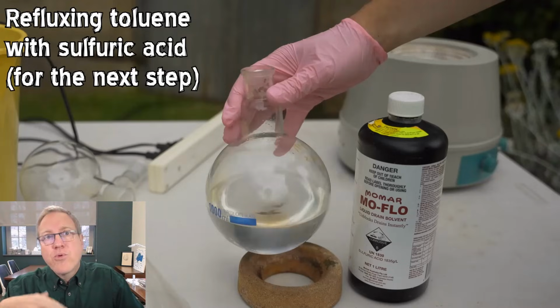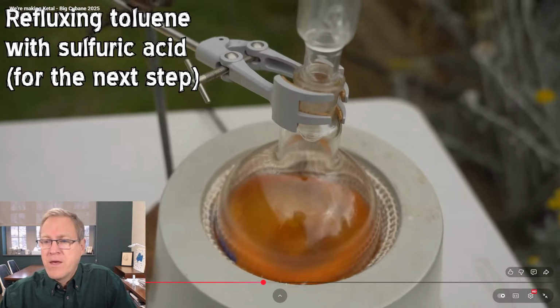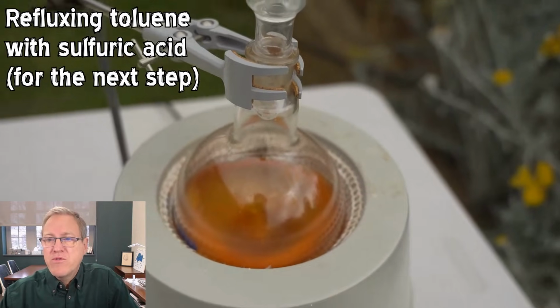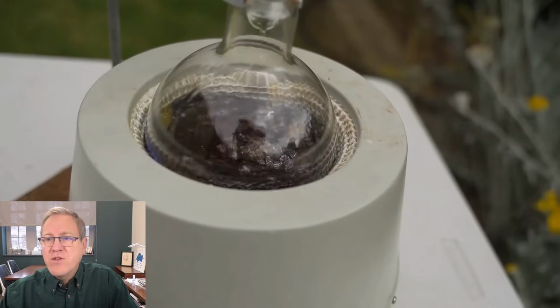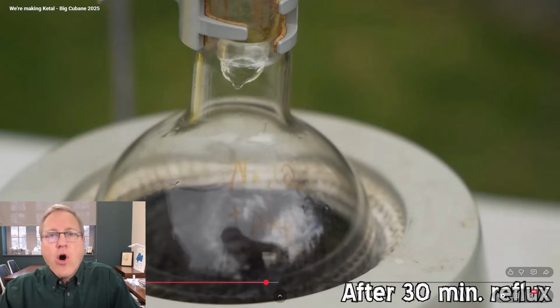Now, he is pre-mixing his acid, his sulfuric acid, and toluene to kind of get rid of some impurities that it might form. We're going to see that here in a second. So he's swirling that around. He's heating this up. Again, we're on mute to cover up the music. And you can see he's getting some discoloration and he's forming some tars in this reaction. This is after 30 minutes of reflux.